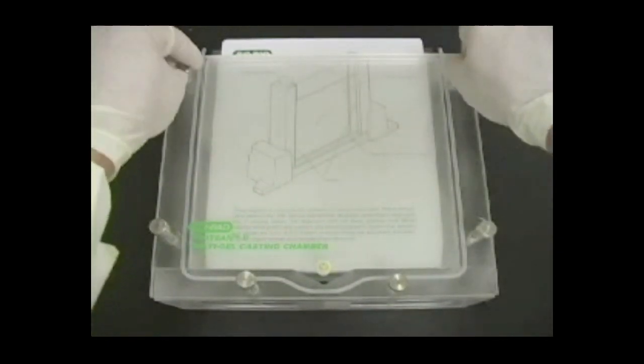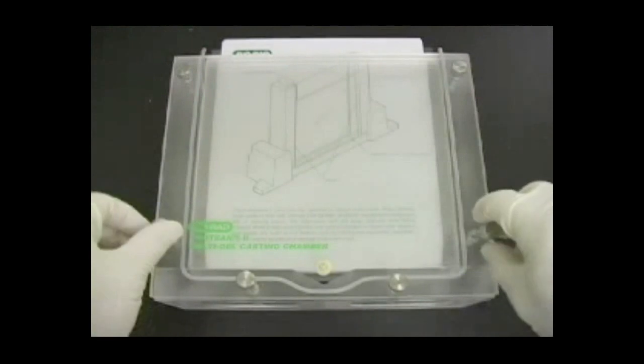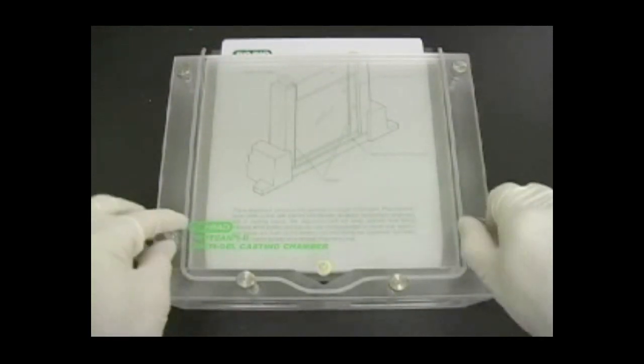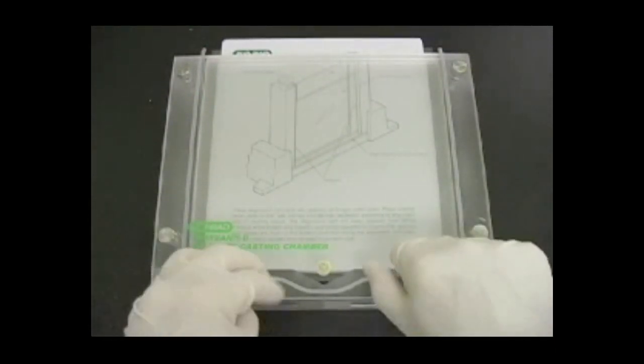Guide the sealing plate into place, being careful not to disturb the stack. The inlet port should match the groove at the bottom of the chamber. Be careful not to block the inlet port with a separation sheet.